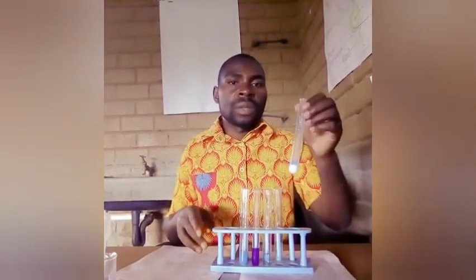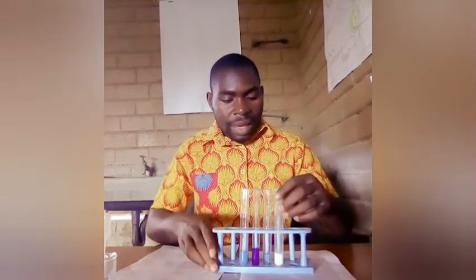How do you understand that? You go to where there is acidified barium nitrate. That's the one we used, and it formed a white precipitate. You can check, this is the white precipitate it formed. So this is guiding us. Now that we have identified this, we are going to write sulfate. Just sulfate is enough.